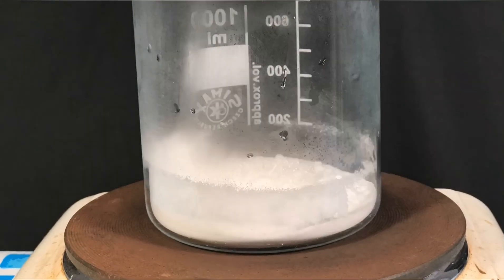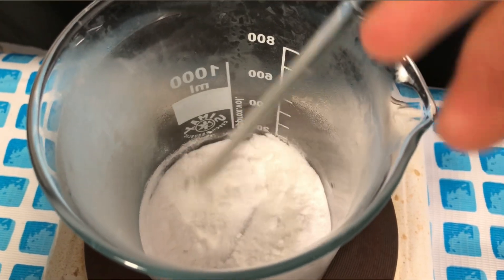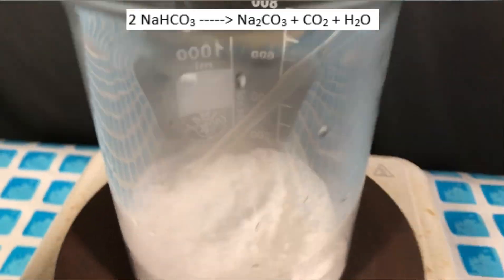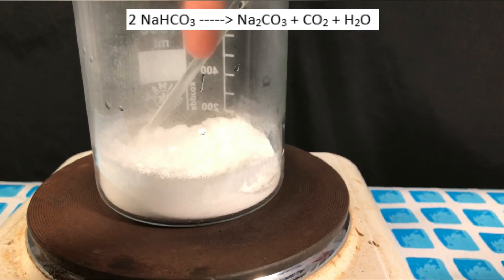At this temperature thermal decomposition will take place. Sodium bicarbonate decomposes to sodium carbonate, carbon dioxide and water.